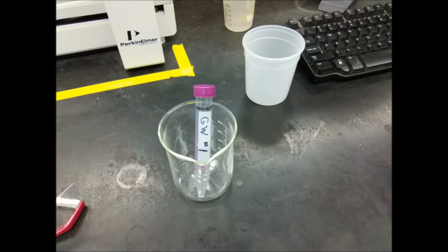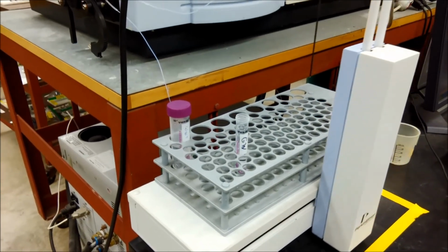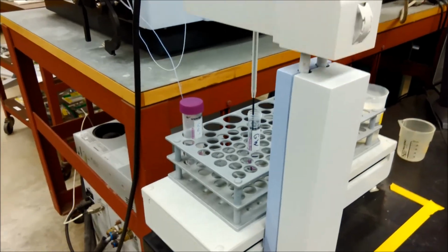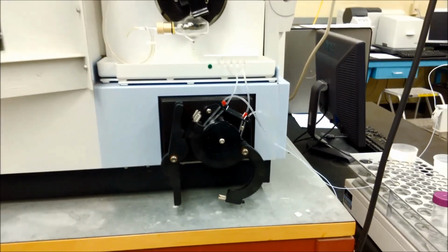When you bring your samples in these small 15 milliliter centrifuge tubes, it only takes about 3 to 5 milliliters of solution to make the measurement, but give yourself a little bit of leeway, so maybe 5 to 10 milliliters of your solution in the centrifuge tube. Make sure the centrifuge tube is clearly labeled. It just makes data record keeping a little bit easier. And then we'll put these centrifuge tubes in the auto sampler of the instrument. We'll load up your sample, and maybe some samples from other students, other groups, into the auto sampler. And then we program the instrument to introduce each sample and look at the emission of lead from each sample.